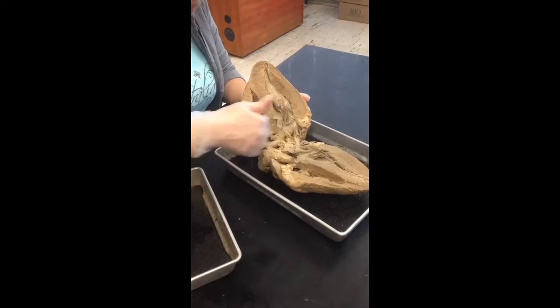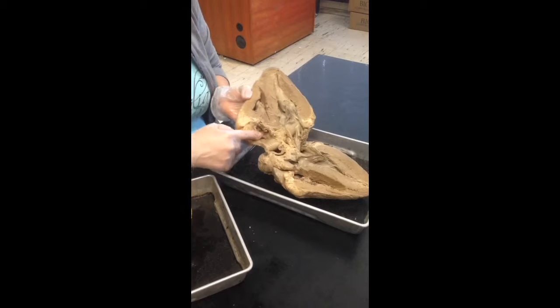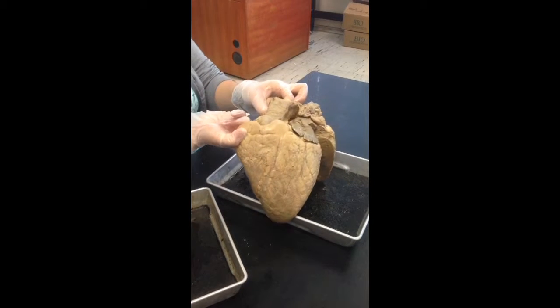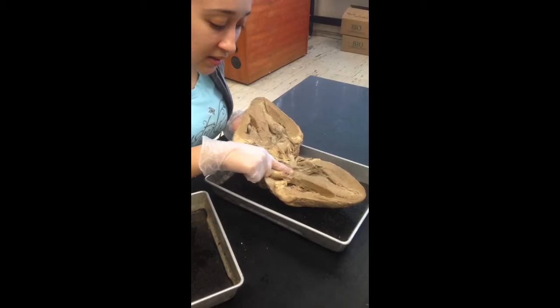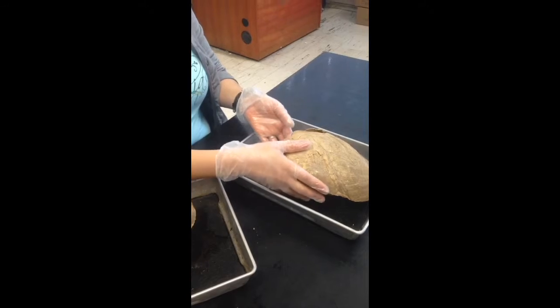Okay, coming up from the right side, if you're talking about the flow of blood, it's going to come up and then pass, well, it's torn up, but that's the pulmonary semilunar valve, and you can see one of my fingers pressing a part of the pulmonary trunk. If the blood was coming from the left ventricle, it would pass the aortic semilunar valve, and remember, the blood's going to run up to the aorta.